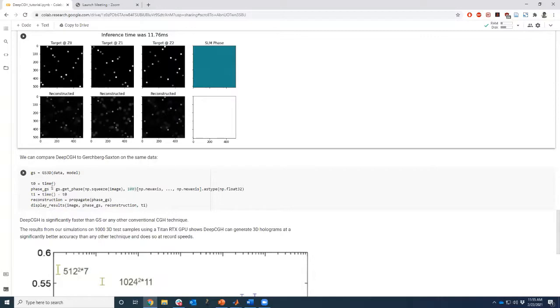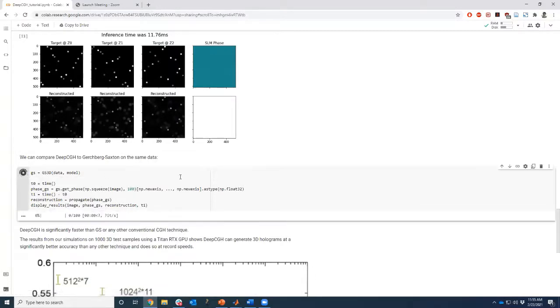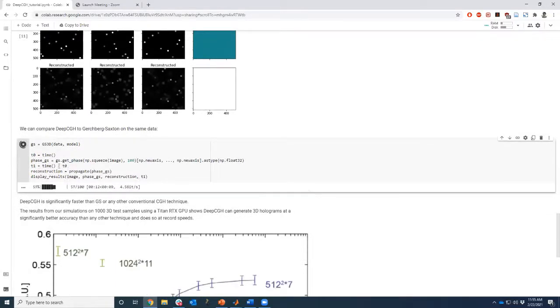So we picked 100 steps. Maybe this is a little bit pushing it, but basically, to give you a comparison, 100 steps is not as greedy in space because it's a step-by-step operation, but greedy in time, which is one of the main drawbacks we had there. And similarly, we calculate the time. Similarly, we run the reconstruction step on the very same data set, and you'll be able to visualize the results.